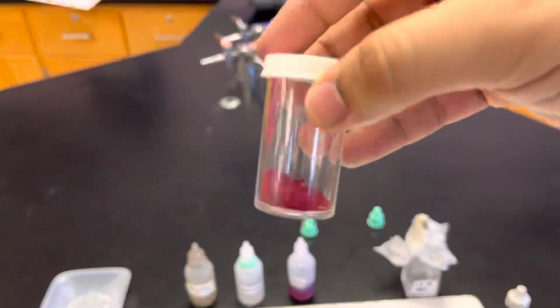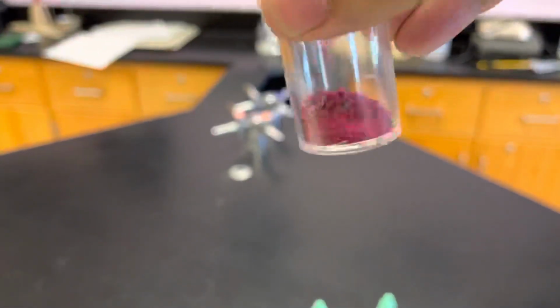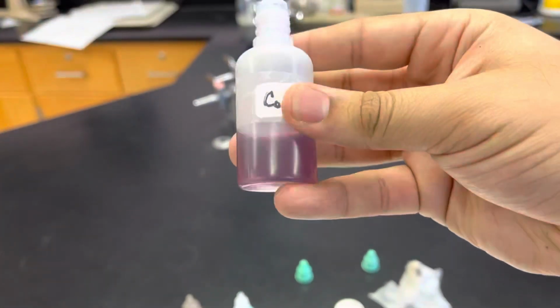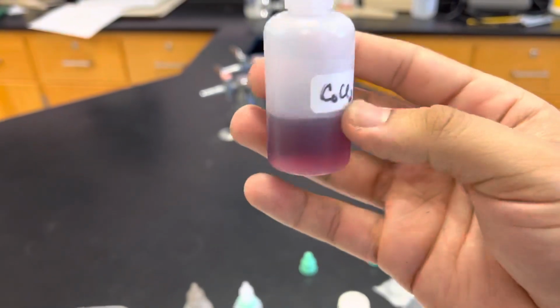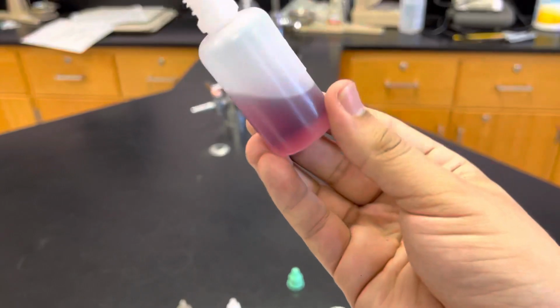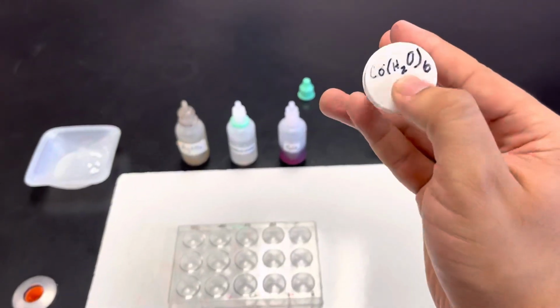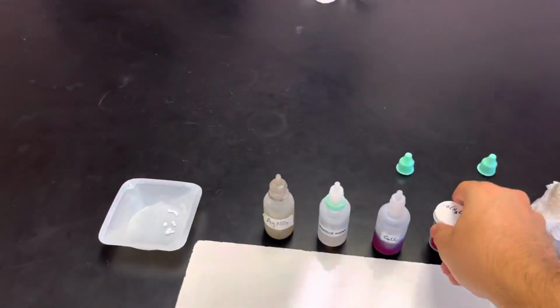This is our solid cobalt(II) chloride hexahydrate. This is what it looks like in the bottle, right? But then when we dissolve it in ethanol, it kind of dissociates into a cobalt hexahydrate and chloride ions. So I guess there are chloride ions in here. But that's what it looks like when it's dissolved in ethanol. Ethanol is just an alcohol. We didn't want to dissolve it in water for this one because water is part of the chemical formula of the stuff, right? So we didn't want to dissolve it in water for that reason.